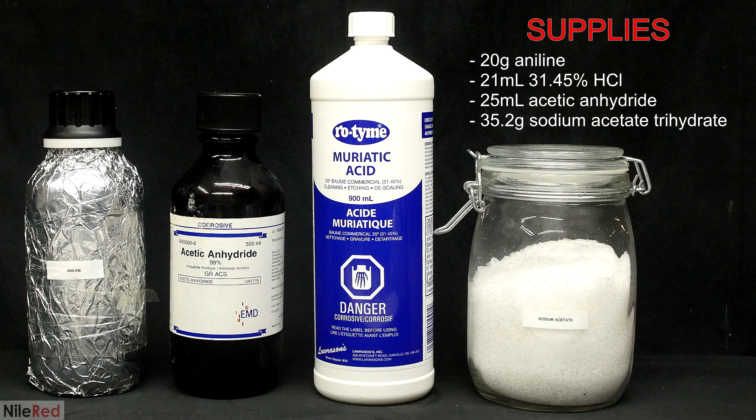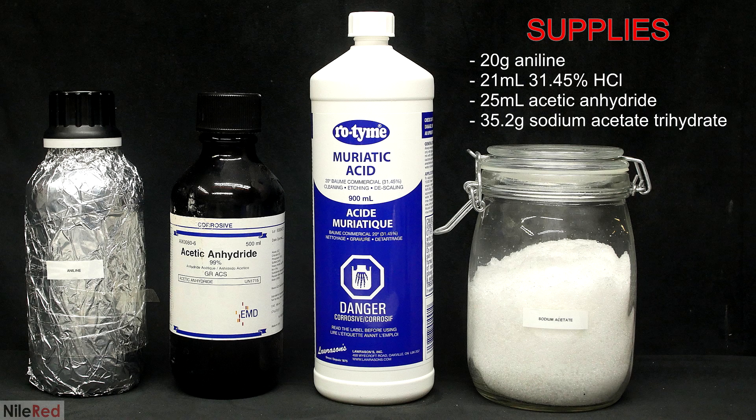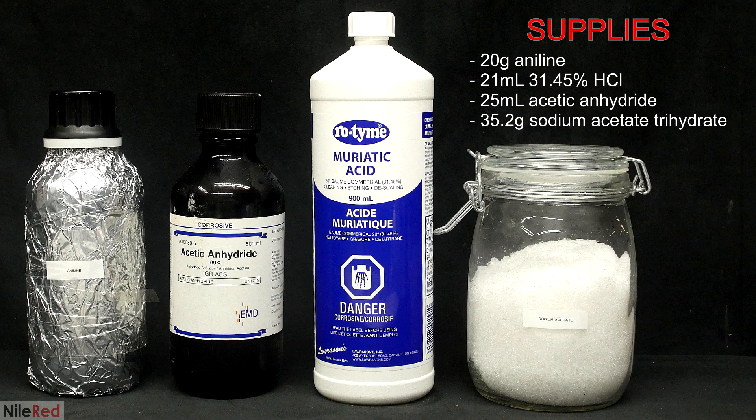So, in terms of chemicals, this is what I need. From left to right, I have aniline, acetic anhydride, muriatic acid, also known as hydrochloric acid, and sodium acetate.